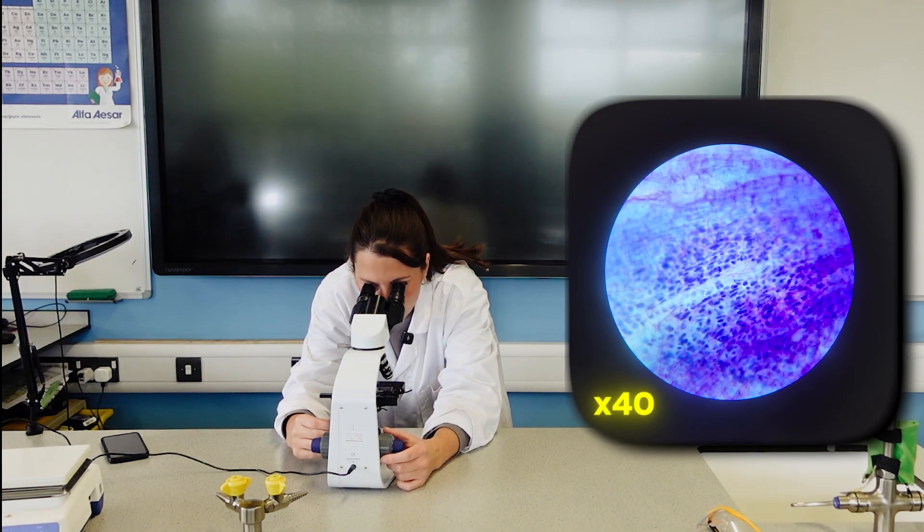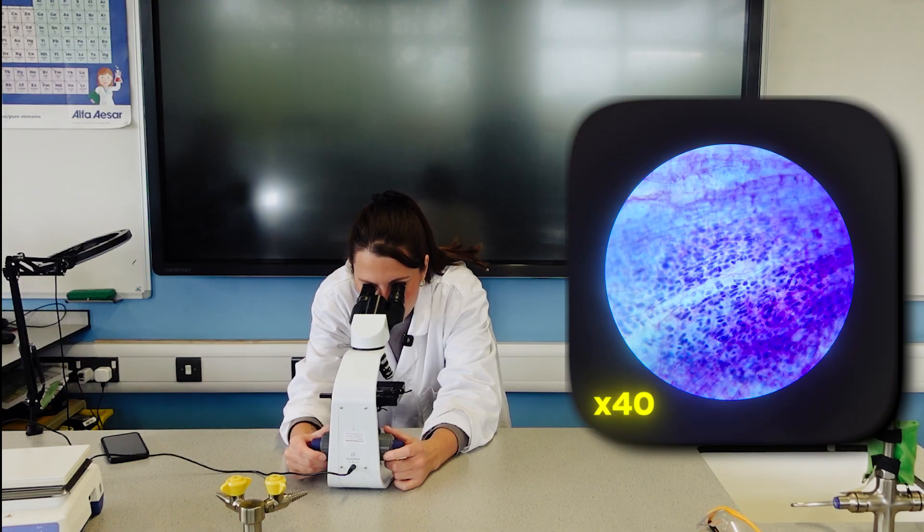So this is now in focus and I can see cells. I'm just going to move it around. Okay, I think I can actually see some already might be in stages of mitosis. I'm just going to adjust the focus and then take a photo so you can see what I'm seeing.